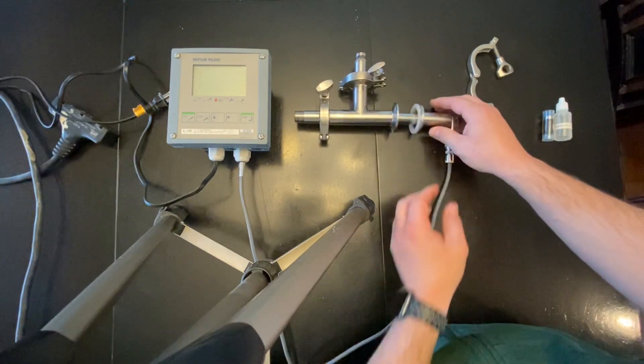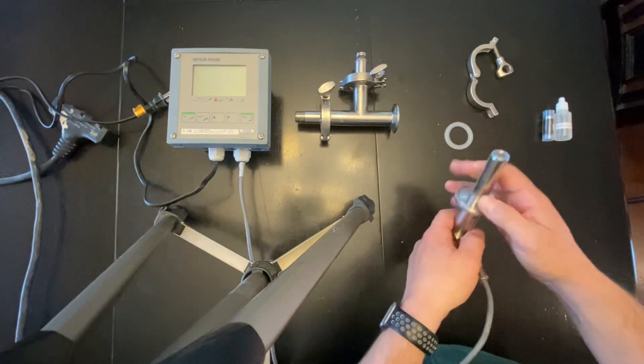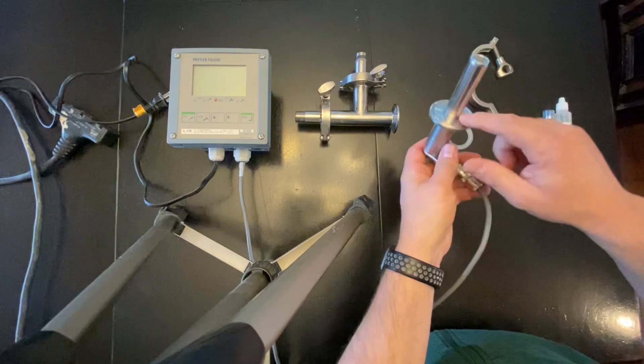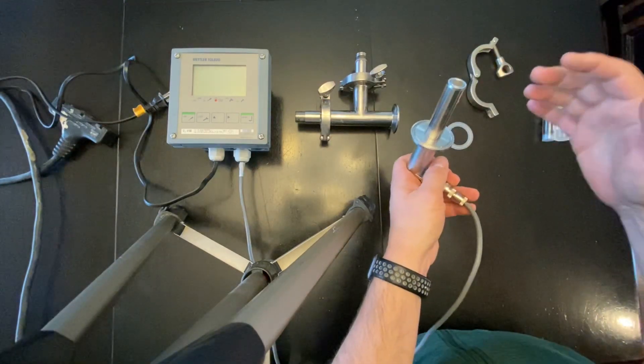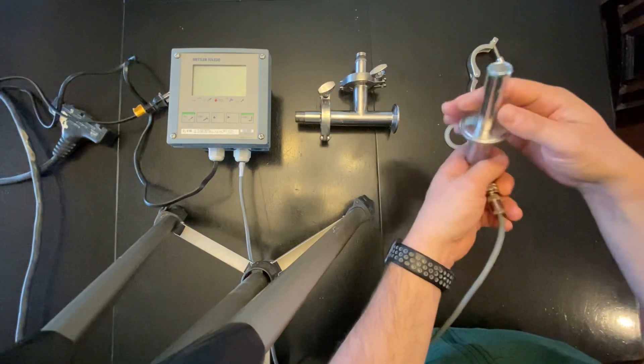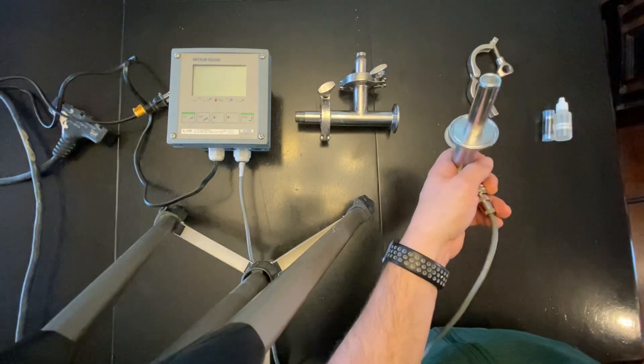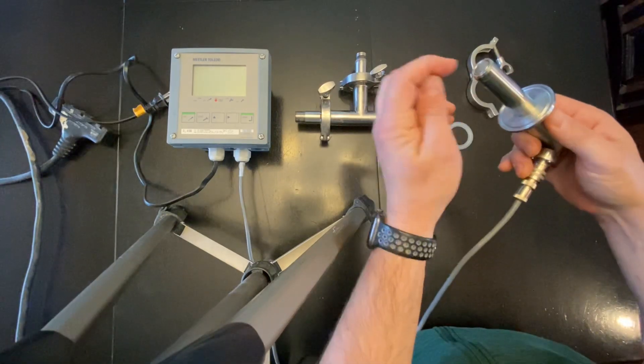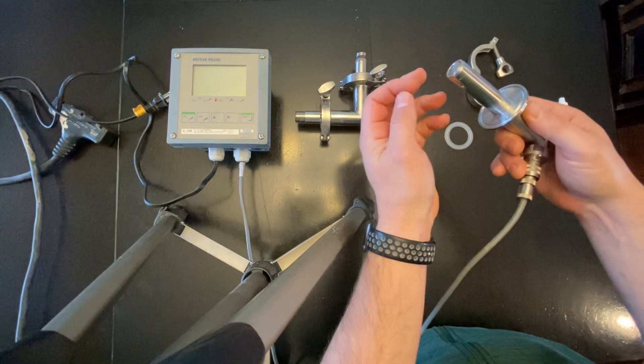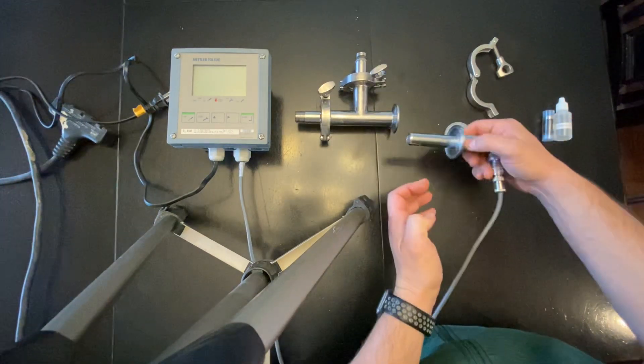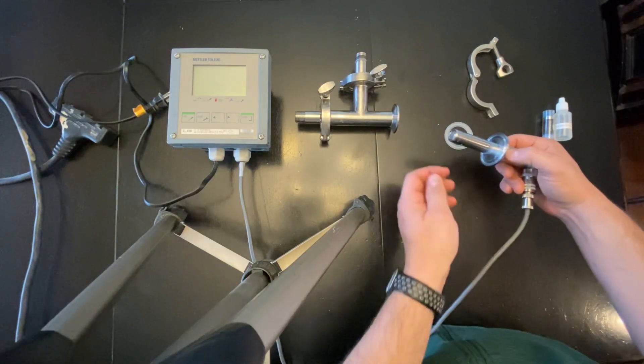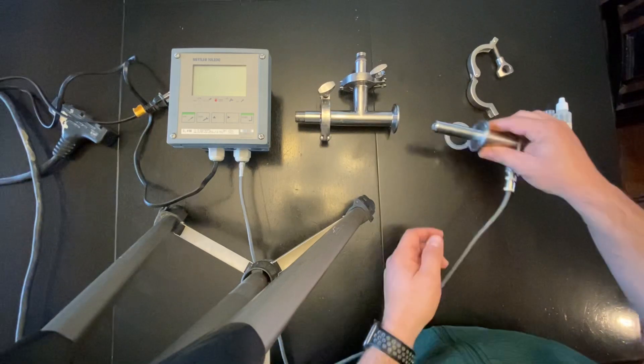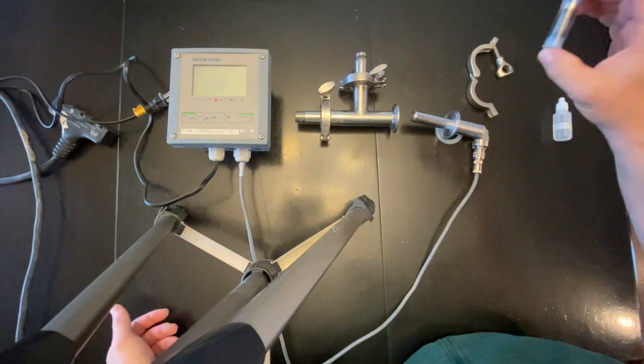Things to be concerned about or watch: your membrane is in here and you will unscrew this to replace your membrane. I don't recommend you unscrewing it because you'll need to replace your membrane. It has a membrane, it has solution. Just watch out for hitting this tip on things. It's a soft tip, so just have caution when you're inserting it into stuff and doing things because you could hit that tip and damage the membrane.